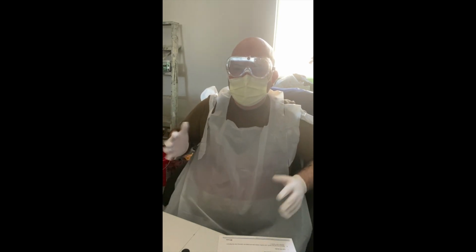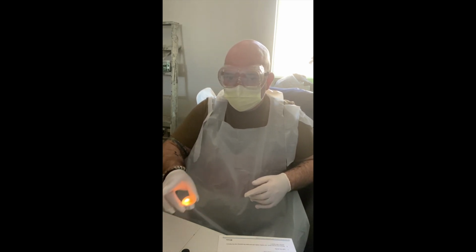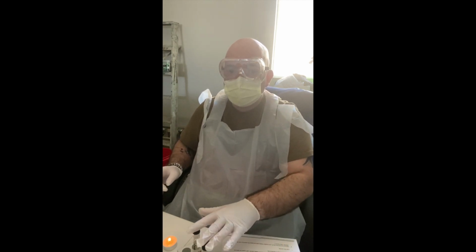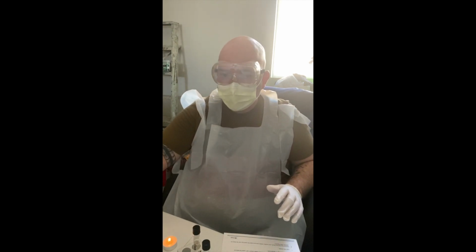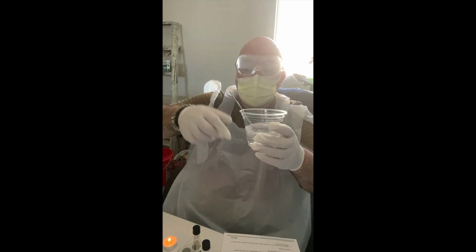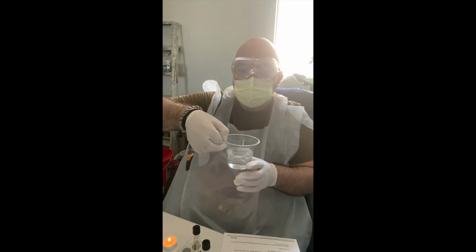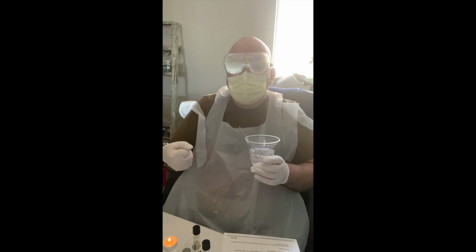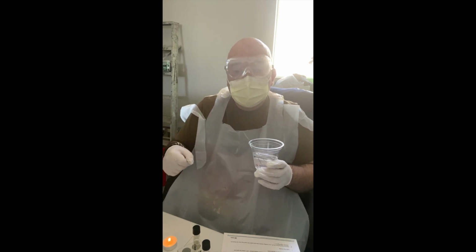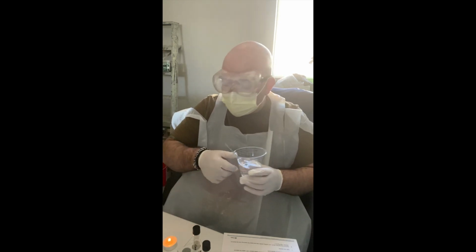The Petri dishes and the motility agar have been in my fridge for several days. I let them out for about an hour and a half, just so they could come to room temperature. I have this tea light again that I'm going to use to sterilize these 2 tubes of motility agar. And then in here I have alcohol, and these are just 2 jumbo straightened paper clips that are sterilizing in alcohol that I'm going to use to collect the CFUs, or the colonies, from the Petri dishes, and that's what I will stab into the motility agar here.